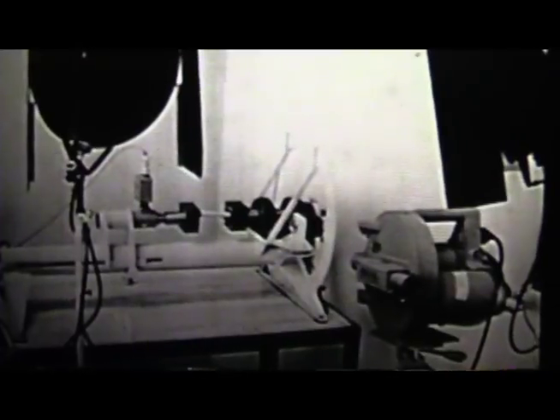First, we have intact dog femurs. They're potted and put in the machine. And now we will produce the fracture. It seems to take a very long time, but of course the film is moving very rapidly. There it goes. Notice the fragments flying off, going into the soft tissues — if they were there — at 300 miles per hour. Fractures occur very quickly, but with our setup we can slow the motion down a great deal.